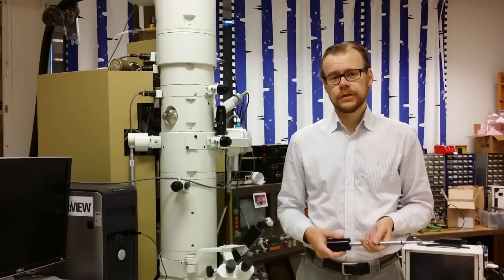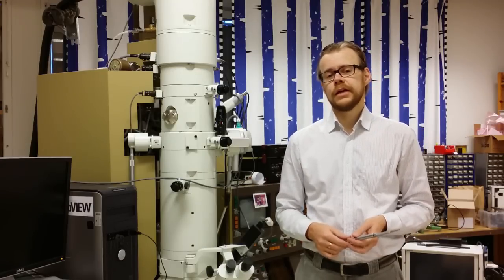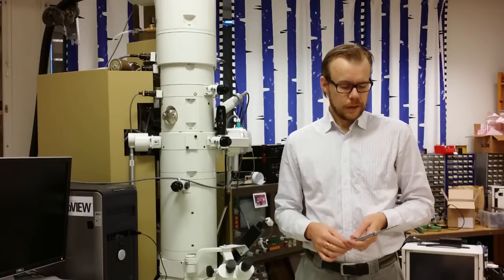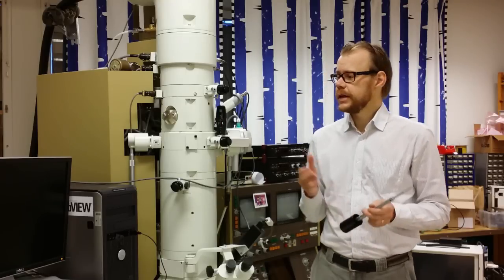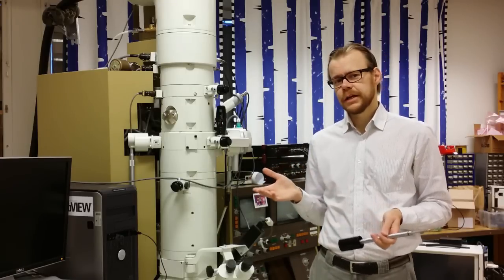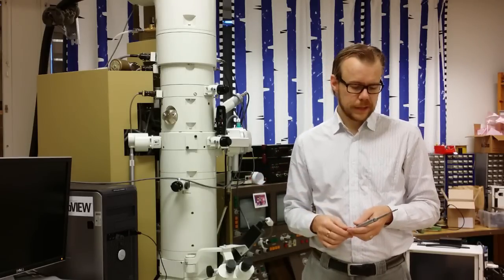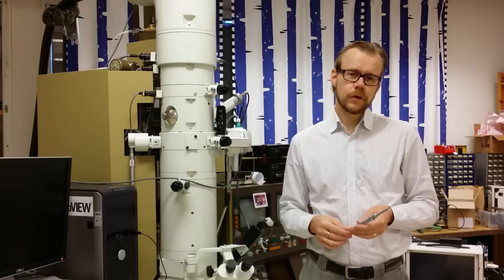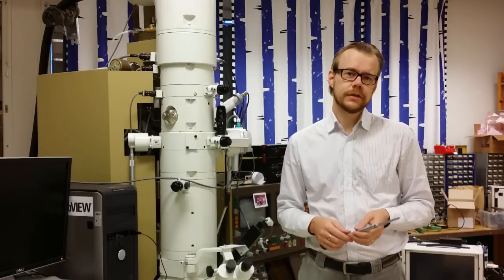Hi, and welcome to the second lecture of the transmission electron microscope. As you can see, today's lecture will be conducted in the lab here with the microscope. And the topic of today is electron diffraction.